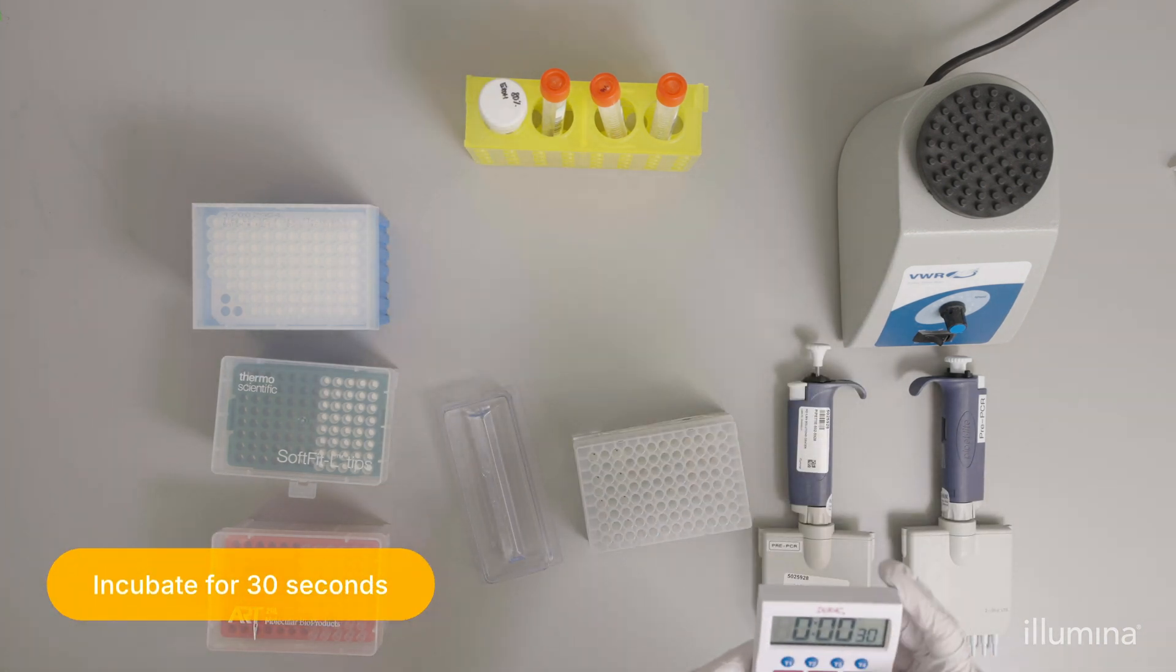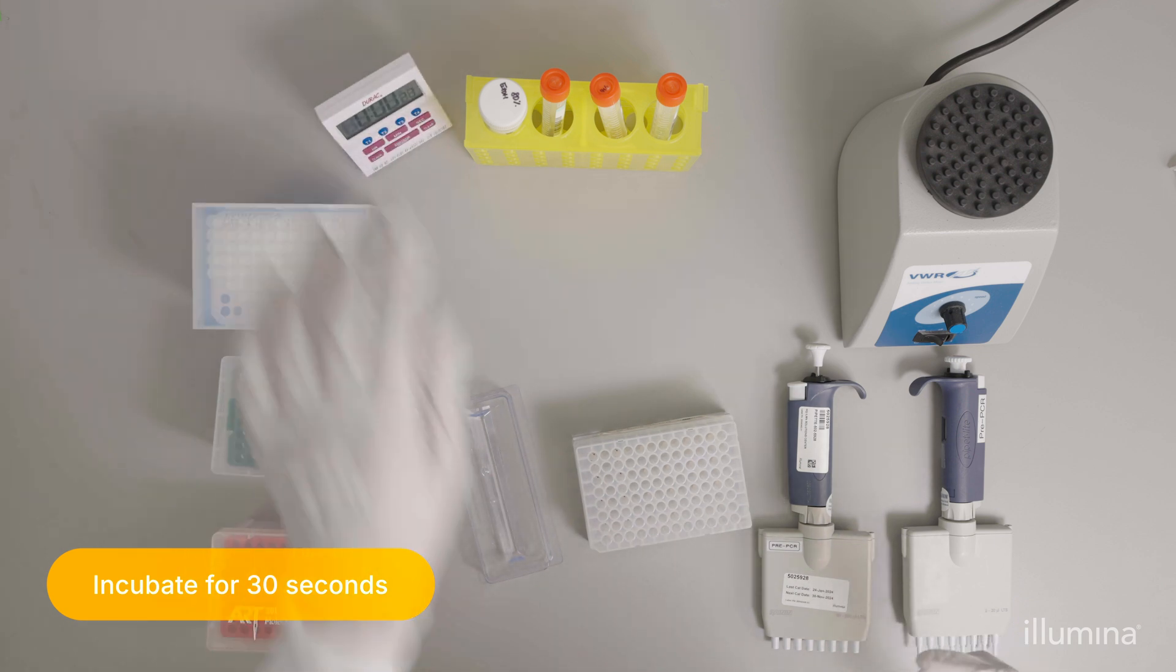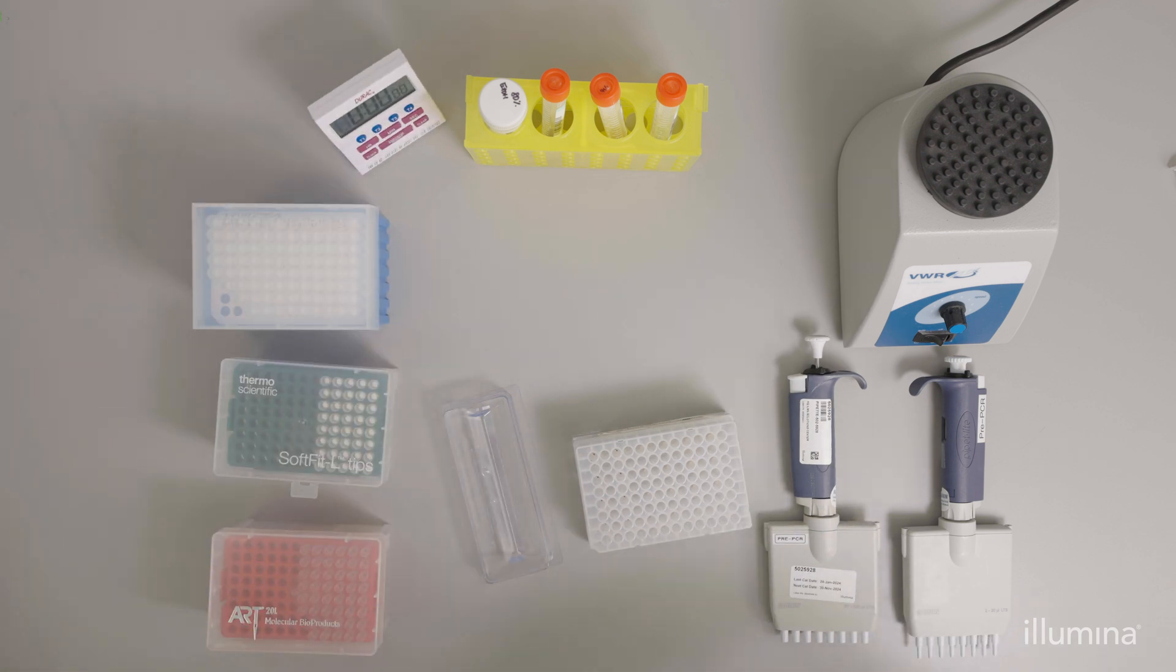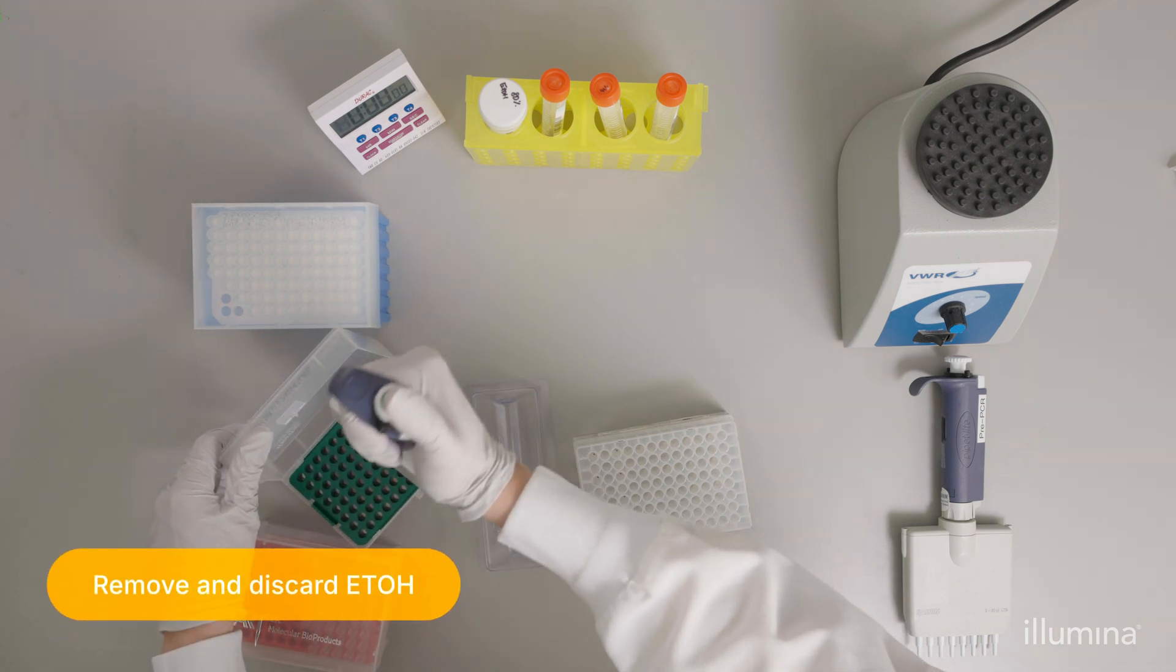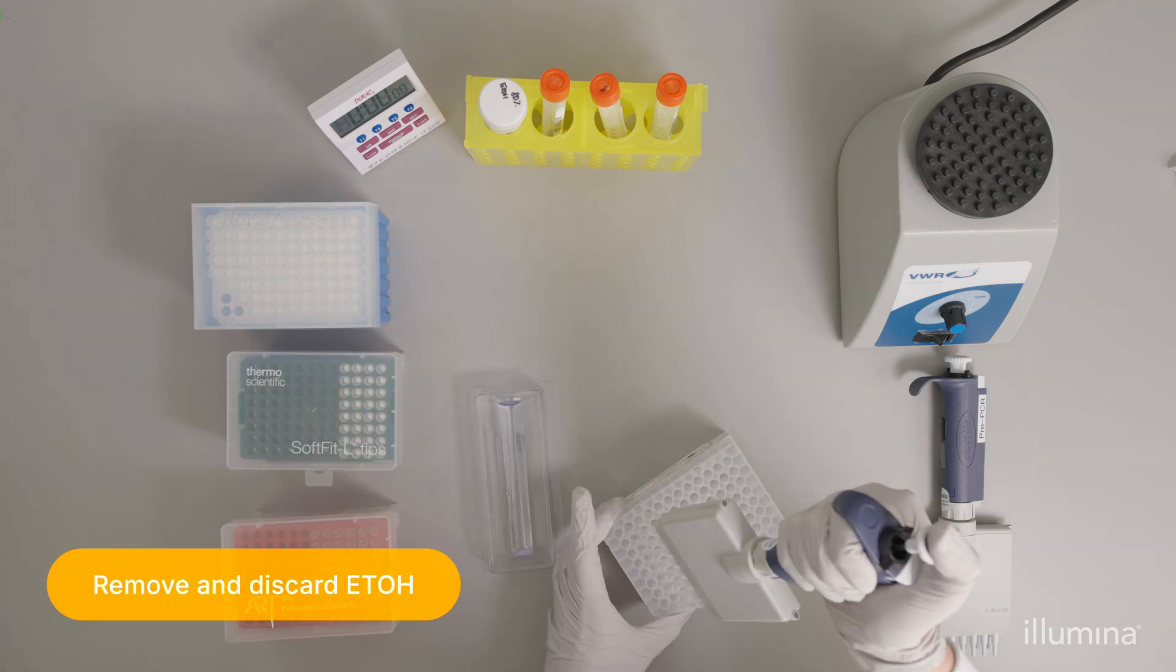Incubate for 30 seconds. Use the 200 microliter multichannel pipette to remove the ethanol from the wells.